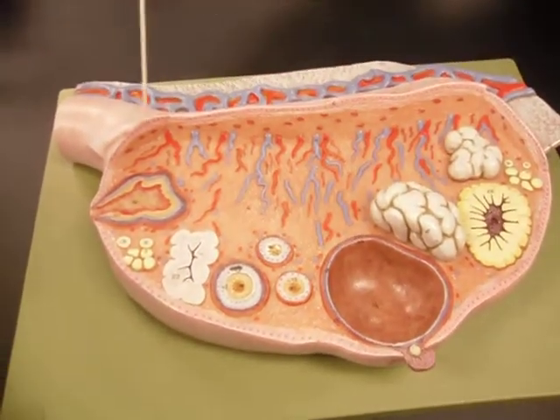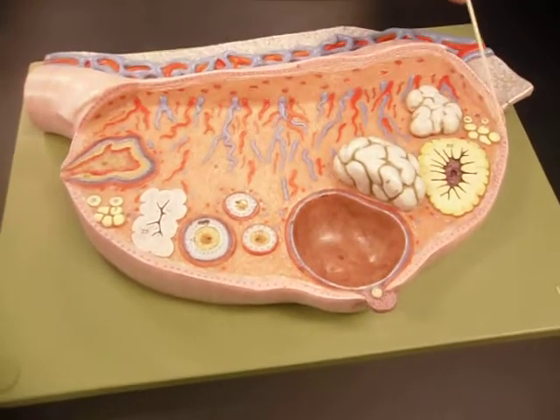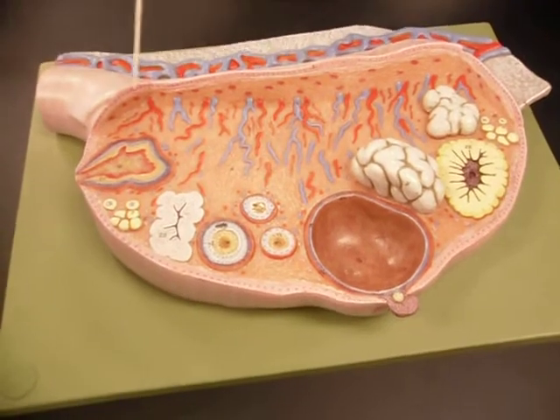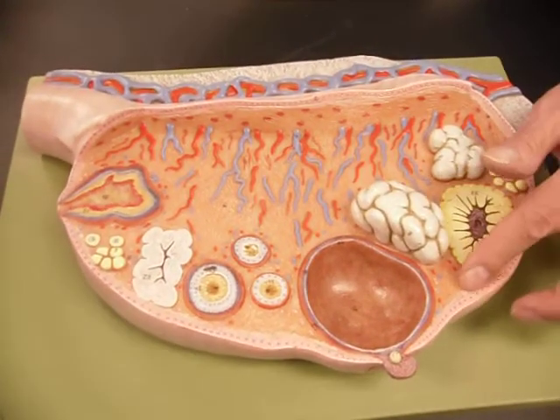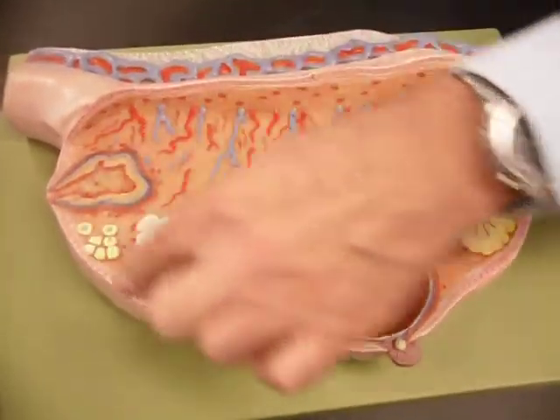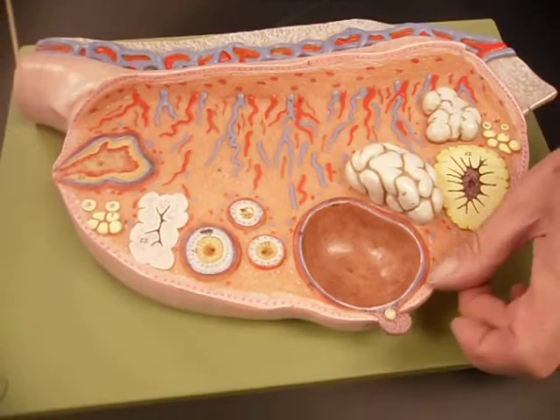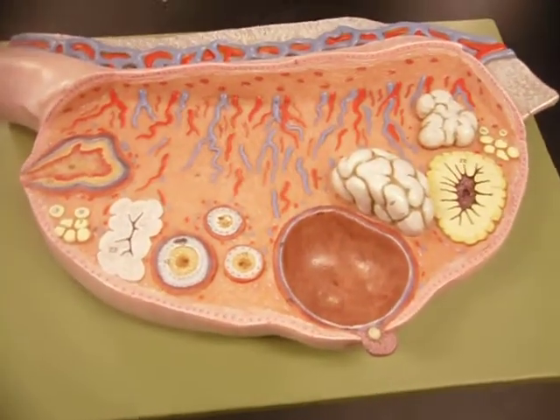All right. Now the very outermost layer, which you can see here in pink, it's a layer of simple cuboidal epithelium, which unfortunately is called the germinal epithelium, which suggests something's developing there, but it's not. Just deep to that, you can see kind of a little tan layer here. That's actually the capsule, which is called the tunica albuginea. Same name we apply to the male capsule around the testes, all right?